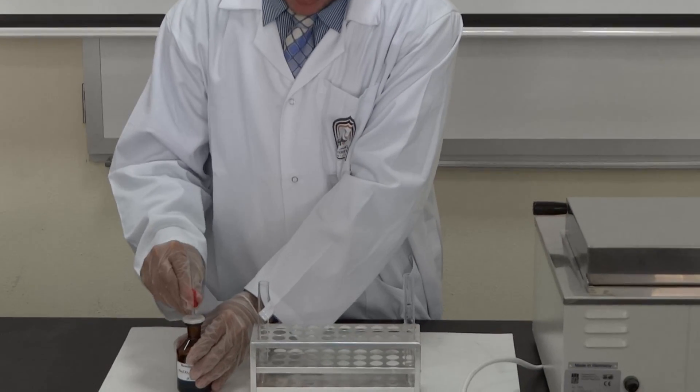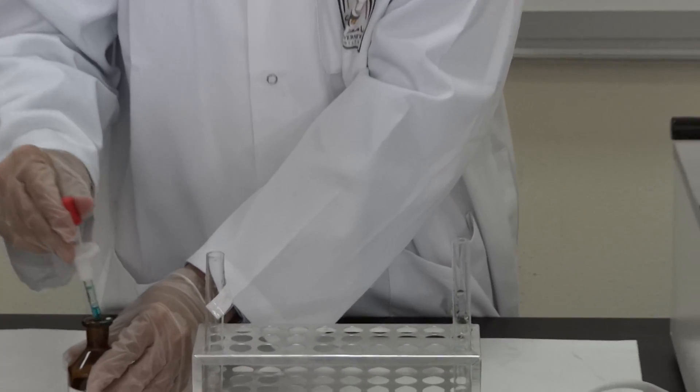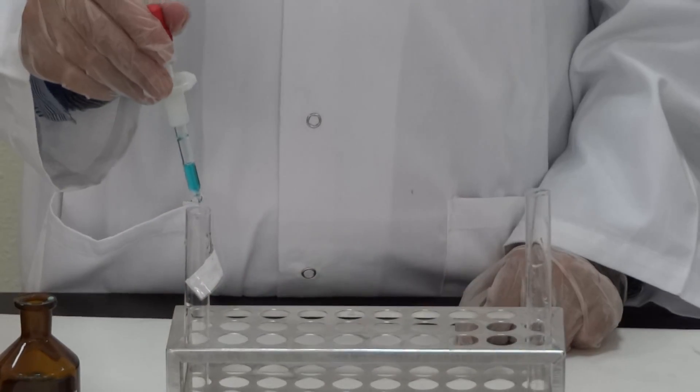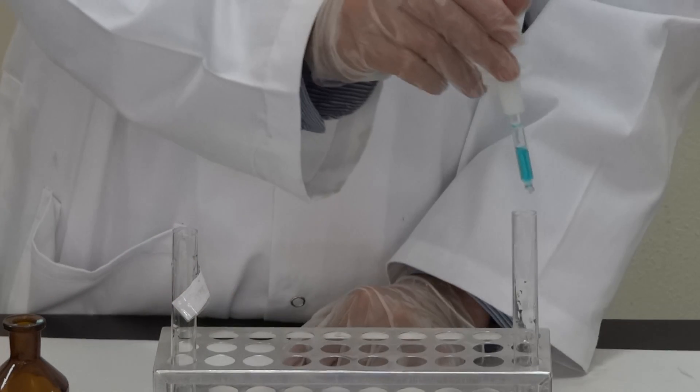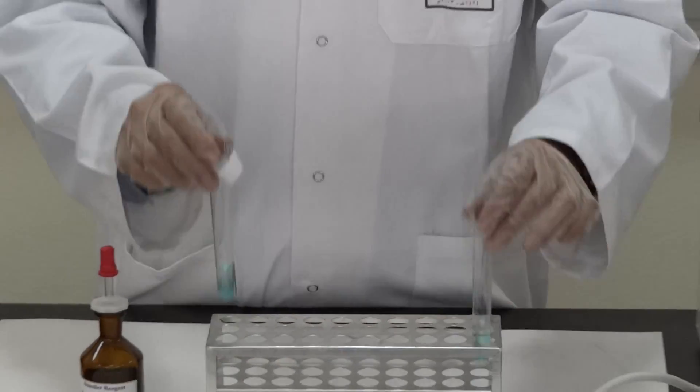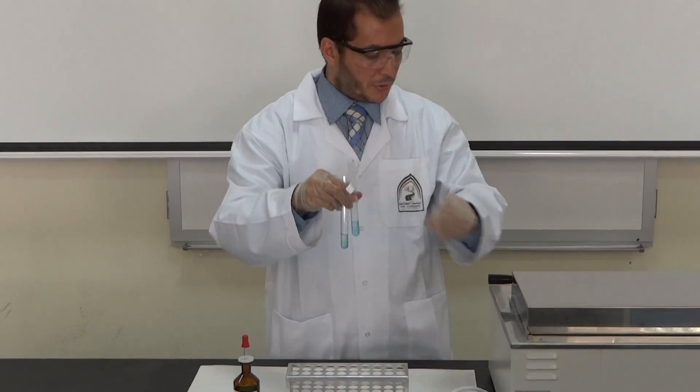What do you expect? The blue color. Add a few drops of Benedict reagent to both test tubes. Check the color is blue, as you can see. Then put both of them in the water bath.